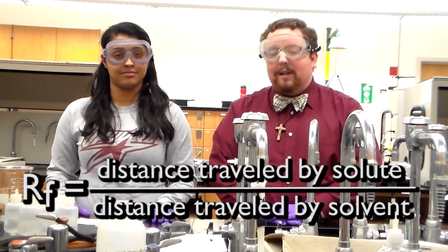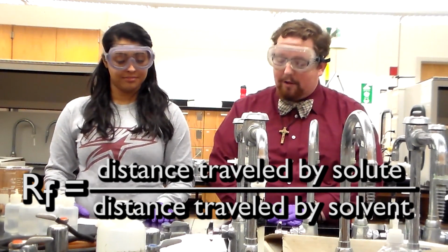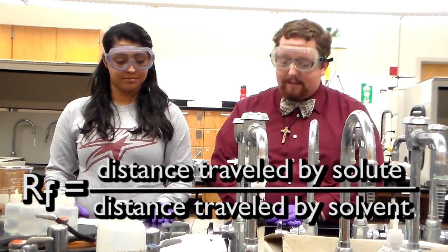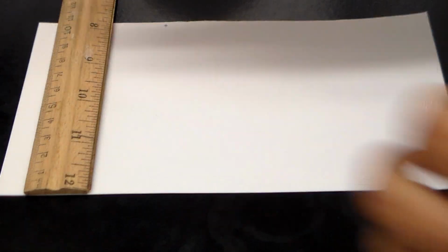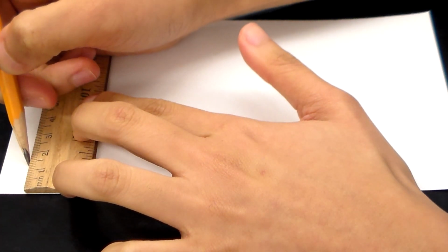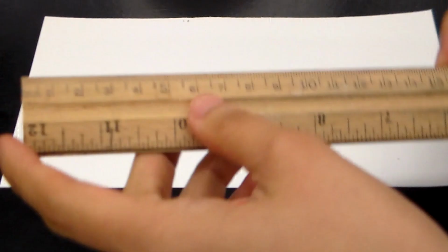You will be calculating what is called an RF value, which is the distance traveled by the spot on your chromatography paper relative to the distance traveled by the mobile phase. Let's get started. Get a piece of chromatography paper. Draw a light pencil line 1.5 centimeters from the bottom.